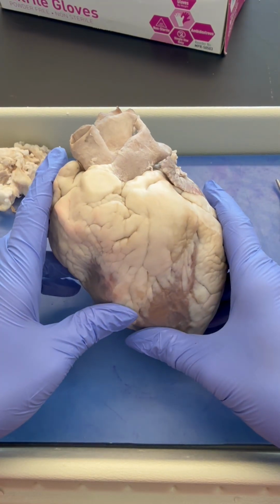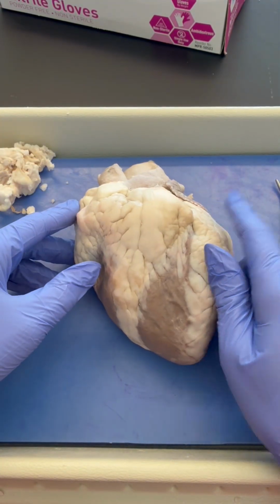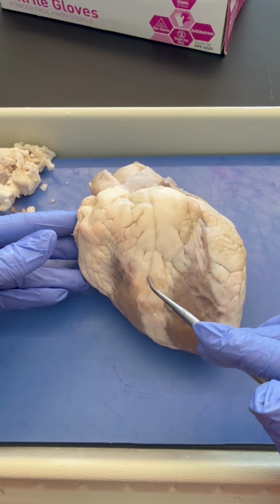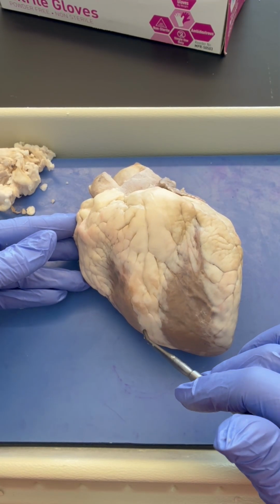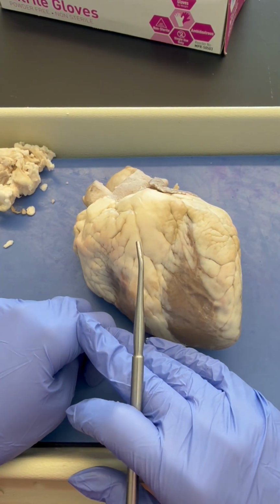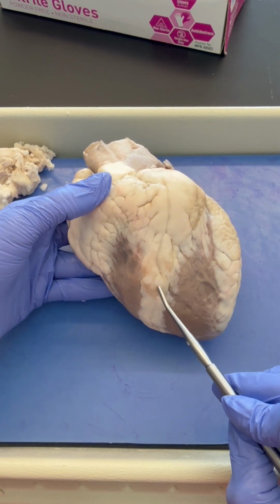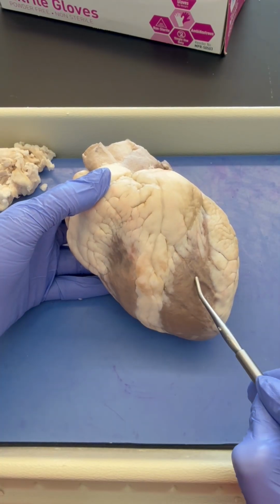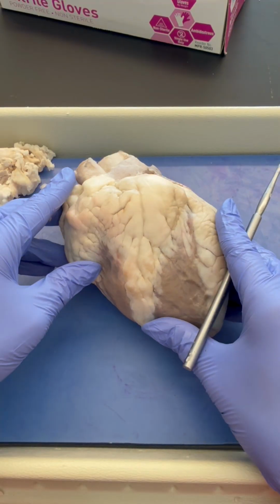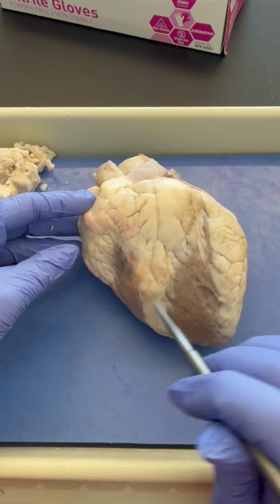The more tricky part is knowing the anterior versus posterior side of the heart, but this isn't too tricky after we learn that the interventricular sulcus runs diagonally on the anterior surface. The name interventricular tells you exactly what it is. If we break it down into two parts, inter and ventricular, inter meaning between, and ventricular meaning the ventricles. So this sulcus or groove is running between the right and left ventricles. Right being the patient's right, or the sheep's right, not our right. So we have to reverse our right and left so that we're doing it correctly. So this would be the right ventricle and the left ventricle.